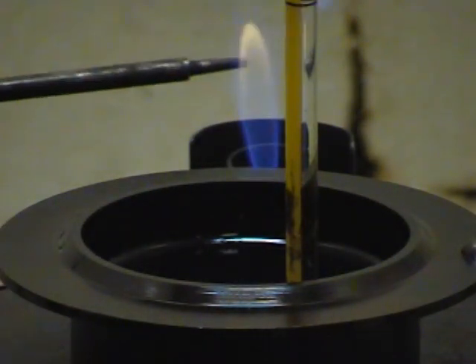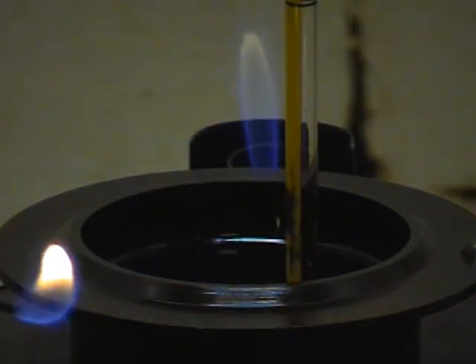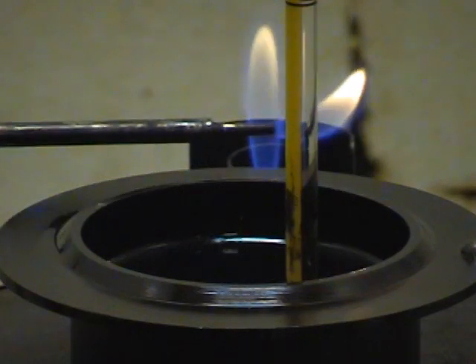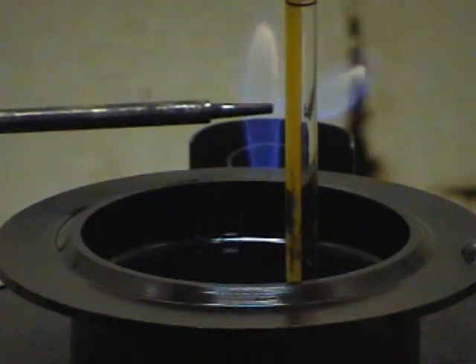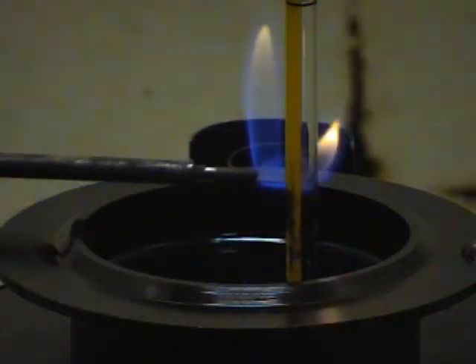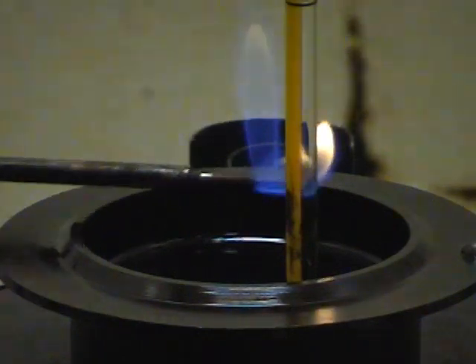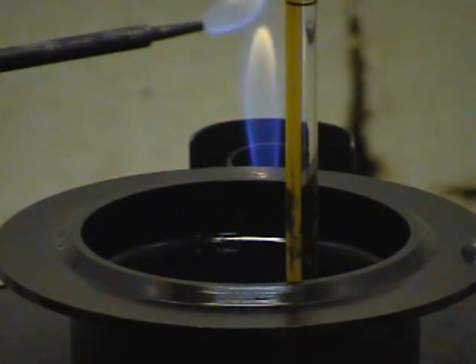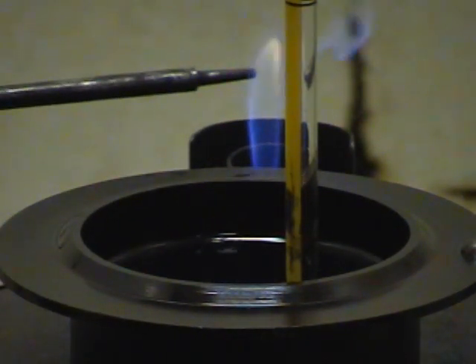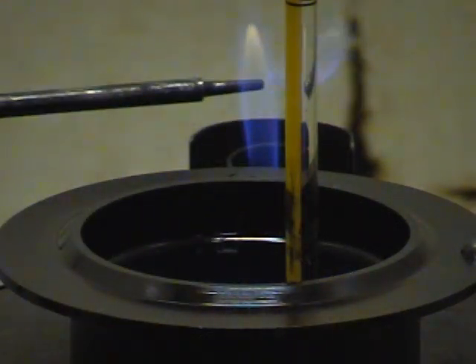I think I saw a flash already at 102. We should be able to determine what type of hydrocarbon this is by the flash point. We just got a flash — got a flash again. We're going to terminate the experiment before we hit the fire point. Okay Mike, you can shut the gas off.